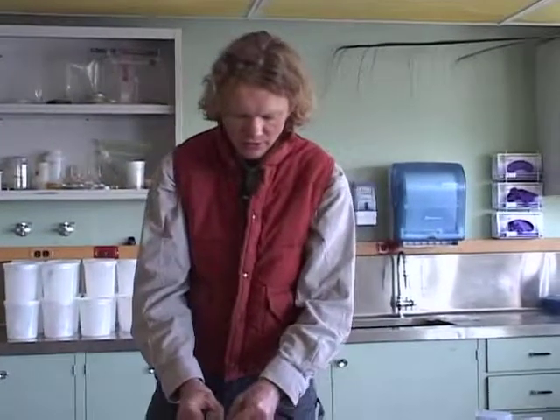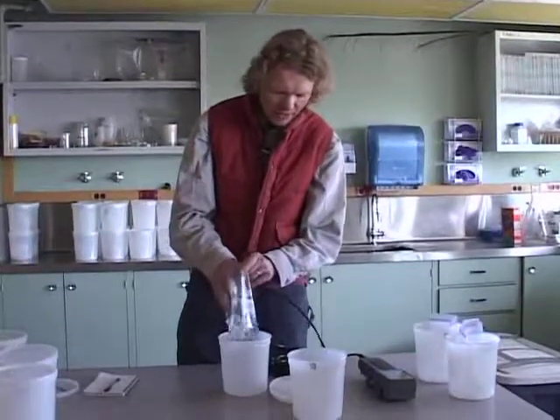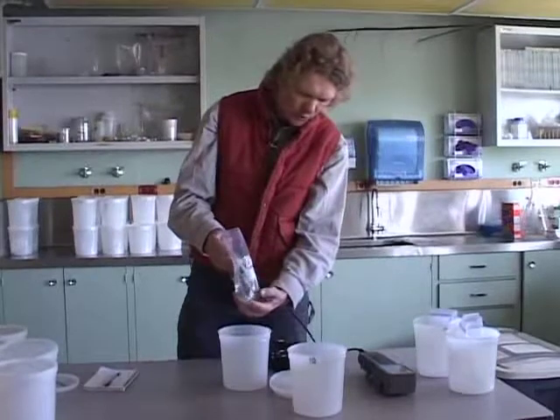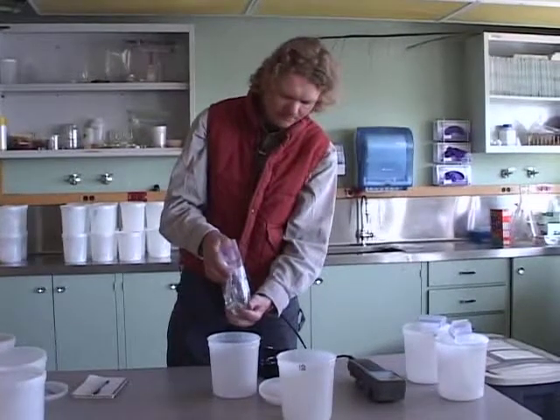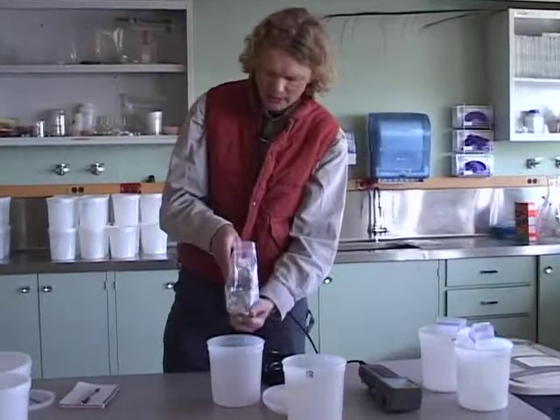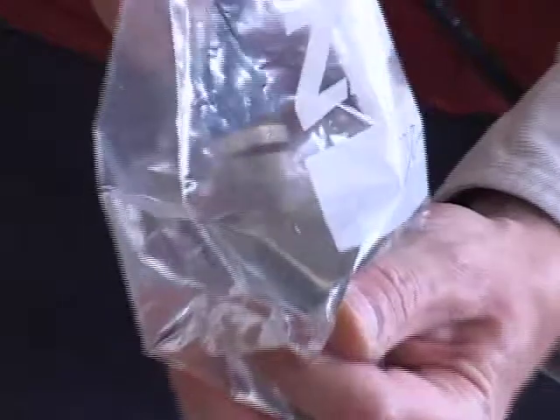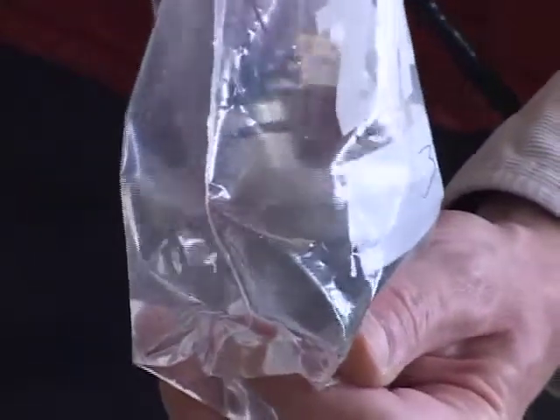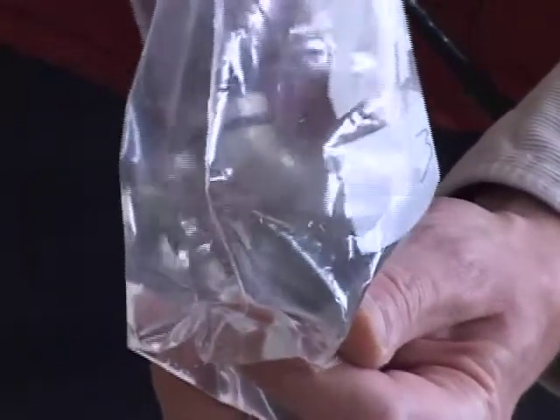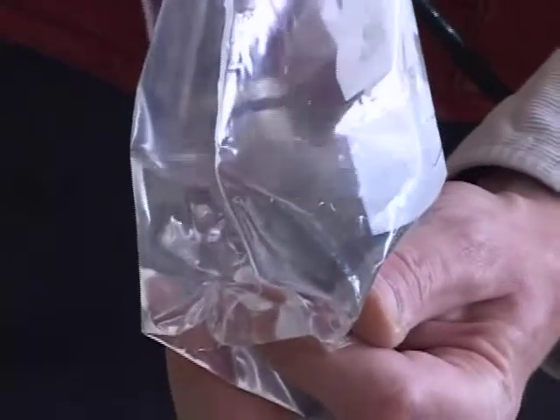All we need to do is make sure that our sample that we're measuring is homogeneous and that the probe is fully immersed in the water. So the water actually has to enter into that compartment that contains the two electrodes, and you want to make sure that there's no air bubbles or gas bubbles in there as you're doing that, and then you wait until the reading stabilizes. So we'll just do one sort of measurement as I would do it.